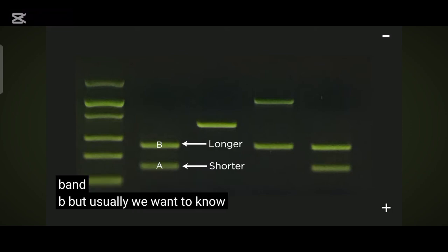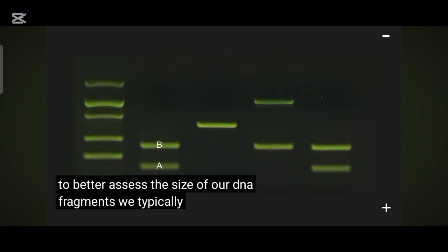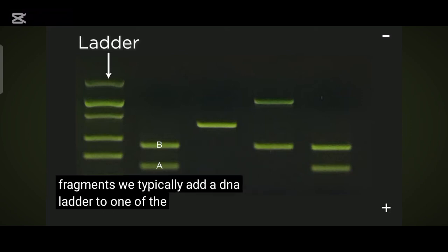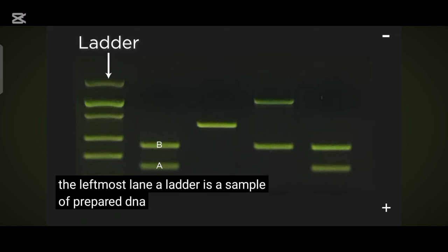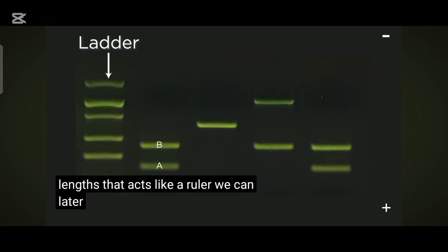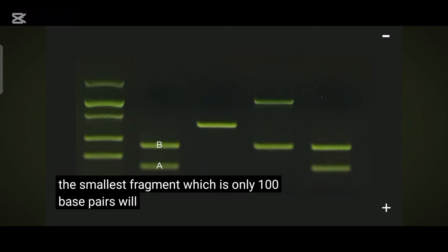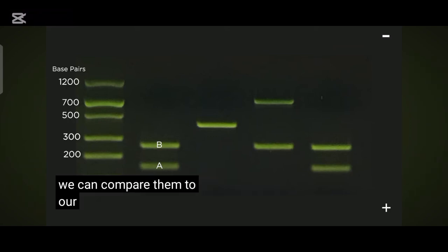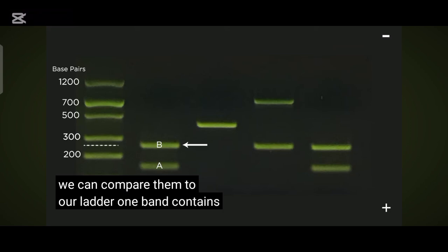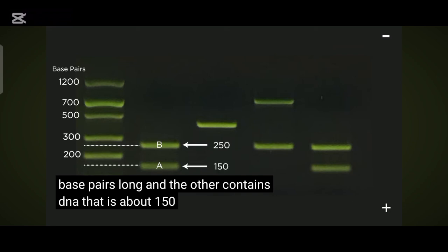Usually, we want to know the actual length of the fragments of DNA we are separating. To better assess the size of our DNA fragments, we typically add a DNA ladder to one of the wells. A ladder is a sample of prepared DNA fragments of known lengths that acts like a ruler we can compare our DNA samples to. The smallest fragment, which is only 100 base pairs, will move the farthest through the gel, then the 200 base pair fragment, the 300 base pair fragment, and so on. One band may contain DNA that is about 250 base pairs long, and another about 150 base pairs long.